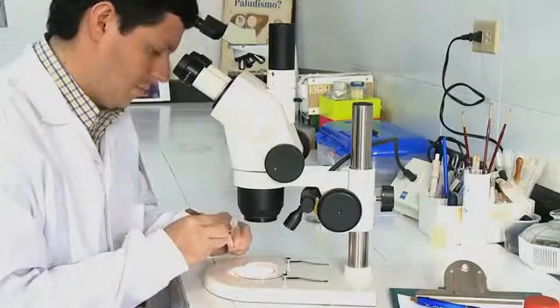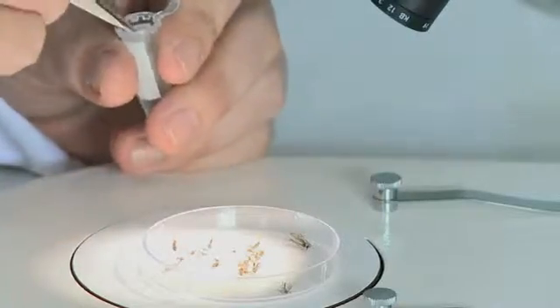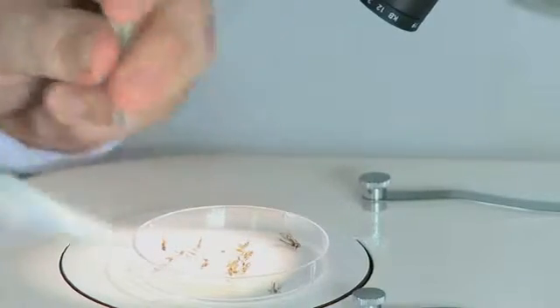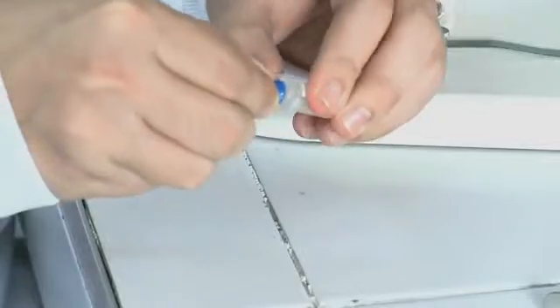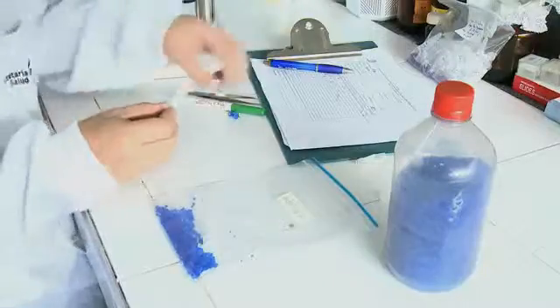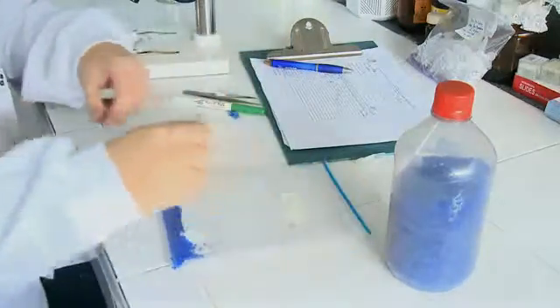Once the test is finished, the mosquitoes should be stored in properly labeled vials. The vials should have a small hole in the lid to allow the escape of moisture. They are then packed in airtight bags with silica gel to keep them for morphological identification and for molecular identification if required.